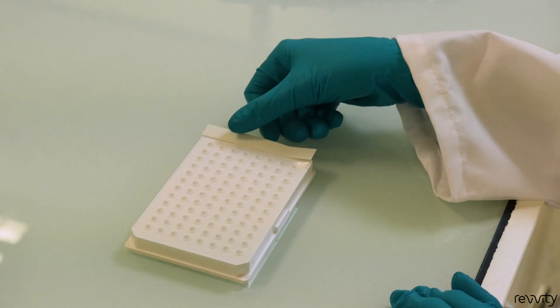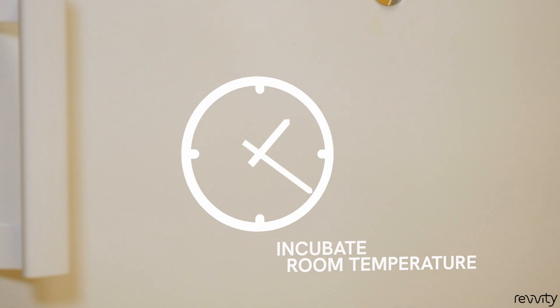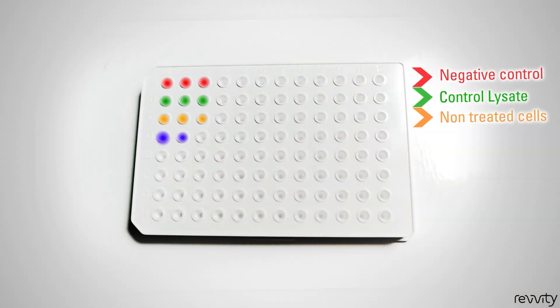Cover the plate with a plate sealer, then incubate at room temperature. Be aware that incubation time depends on the kit. A template map is provided in the protocol.